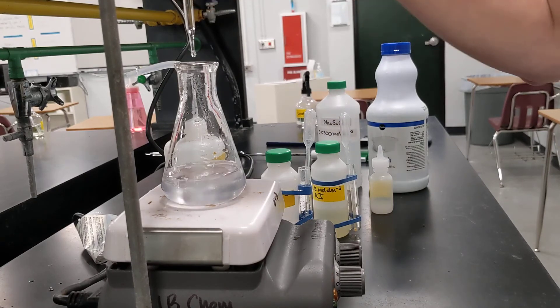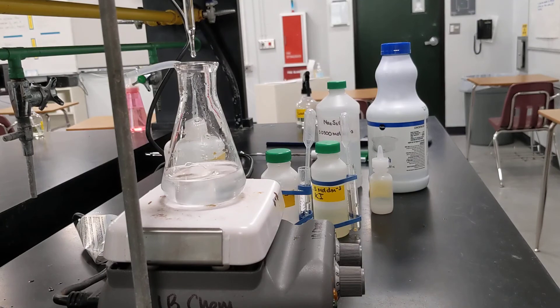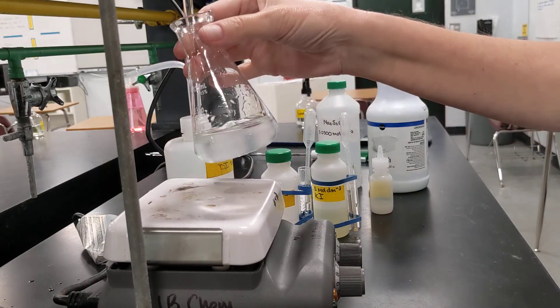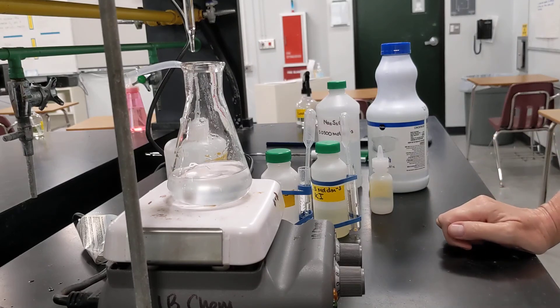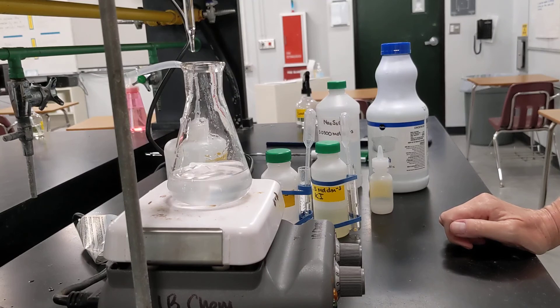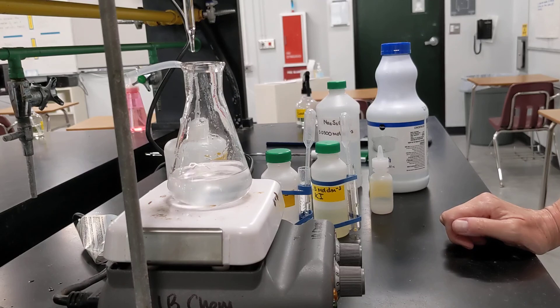All right, so stop here and see. Yeah, looks pretty good. Oh, I have a little hanging chad there. All right, and we are finished. Let's go ahead and get our final volume. Looks like we're at about 29.60 cubic centimeters.